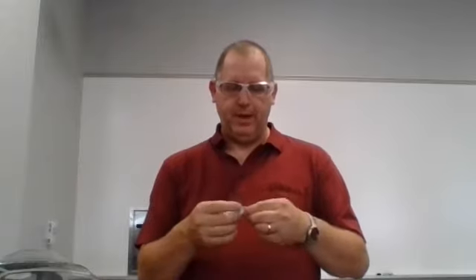So just be patient with me here. I actually set the parafilm on the other side of the room when I was planning on doing it there. And then I discovered that the nice sun that we have in here is giving us some really weird reflections if I do it on the other side of the lab. So I'm like, oh, well, I can move to this side of the lab. That's not a problem. But I left my parafilm over there. So I remove my parafilm here slowly.